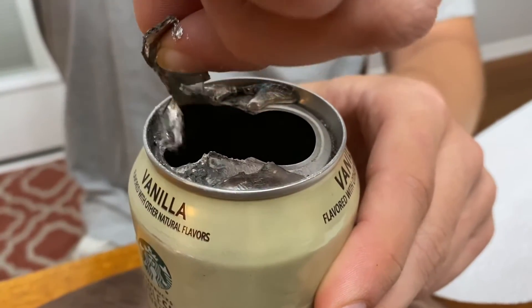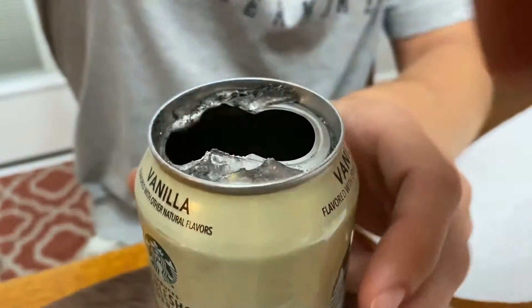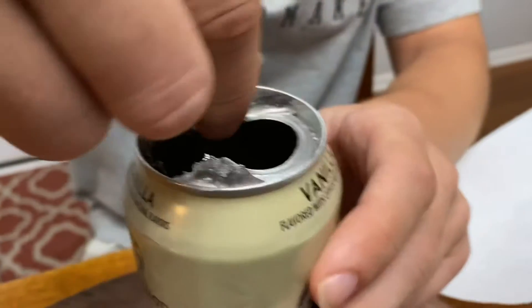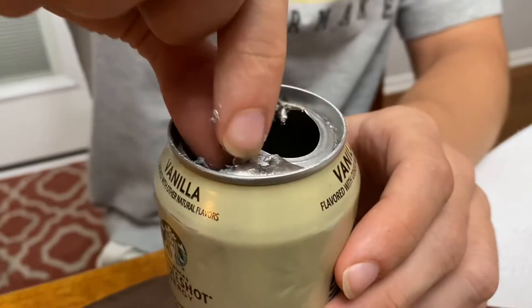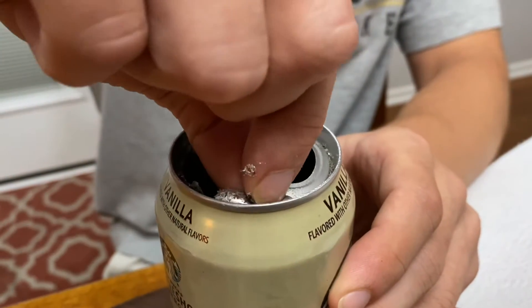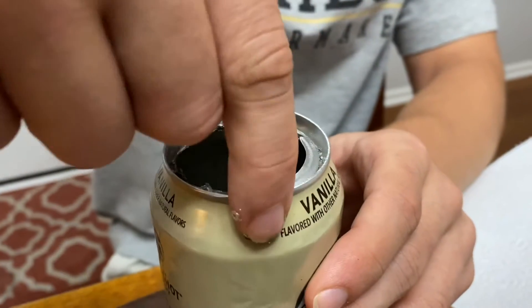This is a physical change — this is just a mixture of metals, this isn't a chemical change. But we're going to demonstrate a chemical change, because when aluminum alloys with gallium, what happens is gallium removes the oxide layer on aluminum. So if you put it in water, the aluminum can immediately react with the oxygen in the water and release hydrogen gas. We're going to test that next in just a minute.